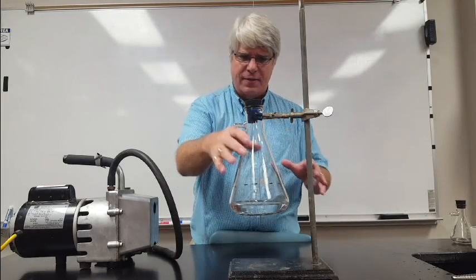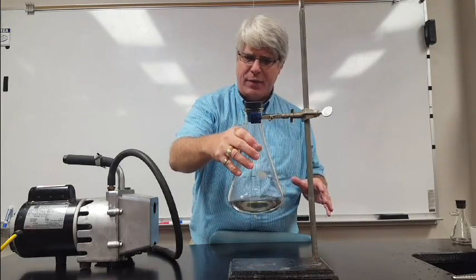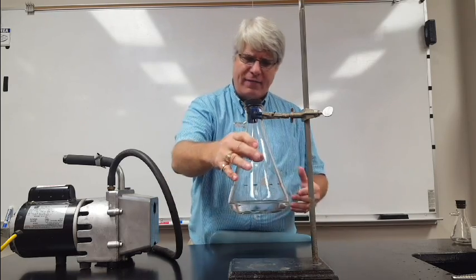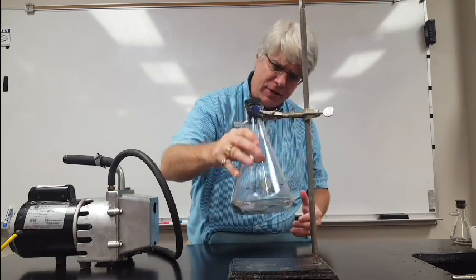What I have here is a flask that's got cyclohexane in it. Cyclohexane is an organic solvent. Now I've got some boiling chips in there if you can see them.